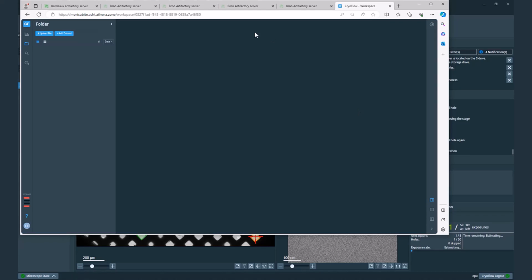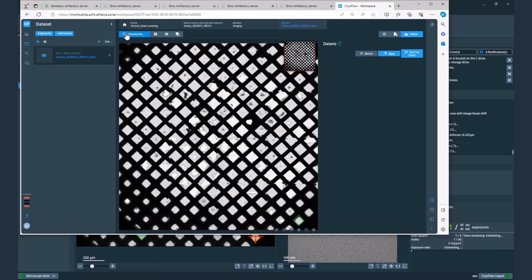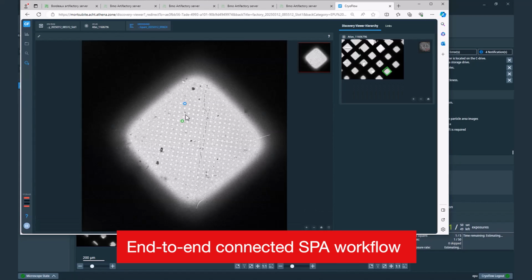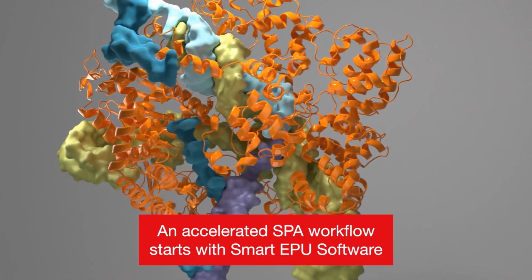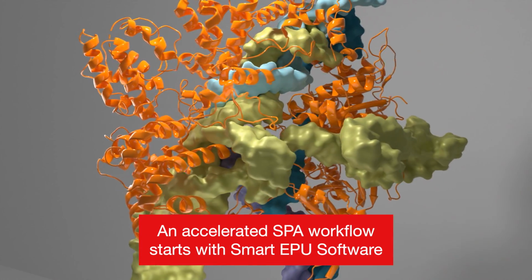Seamlessly connect to Thermo Scientific CryoFlow software, giving you full visibility of your data, from targeting to analysis, on-site or remotely. With advanced automated acquisition and analysis, you can go from raw data to breakthrough discoveries quickly and easily.